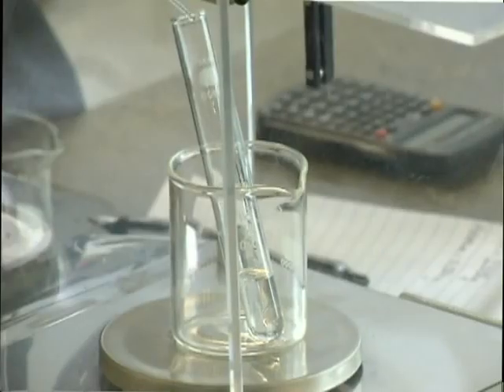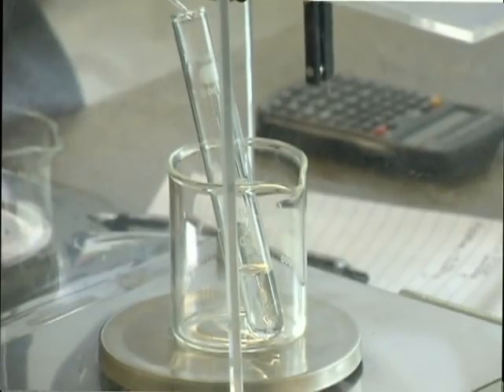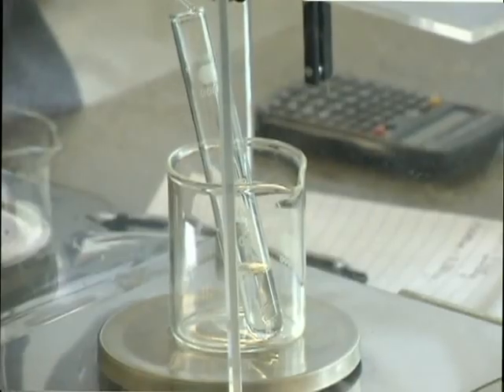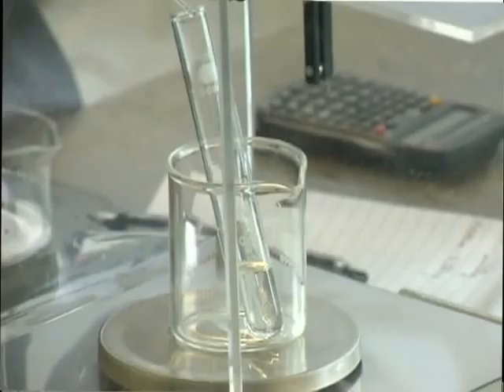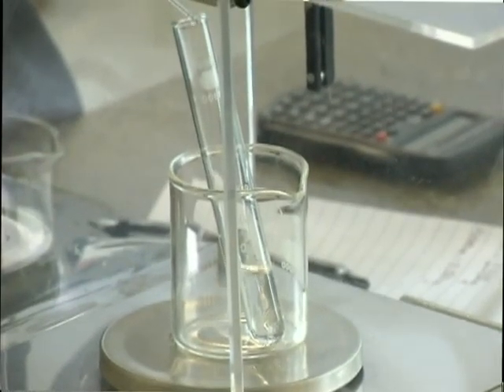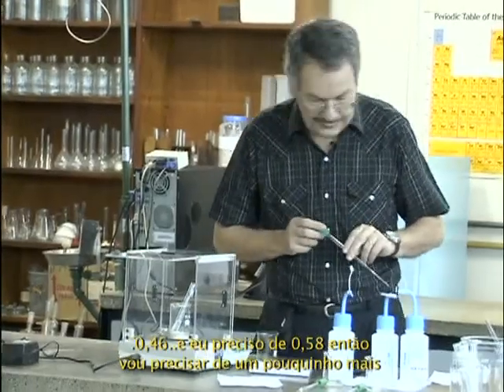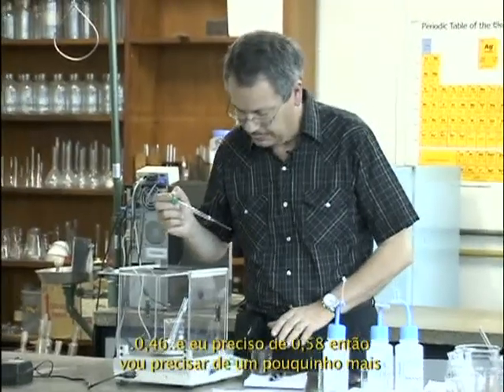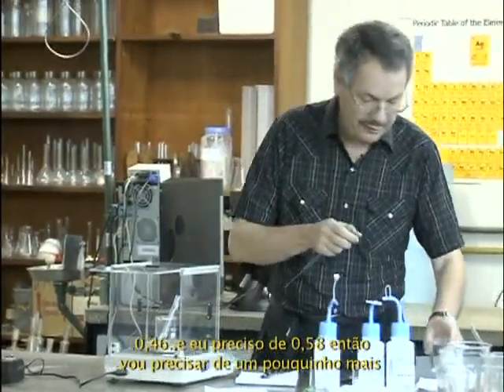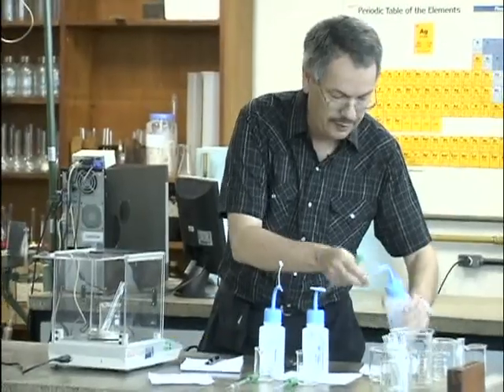Okay, I'm dry. 0.46, and I need 0.58, so I have to take a little bit more, there.